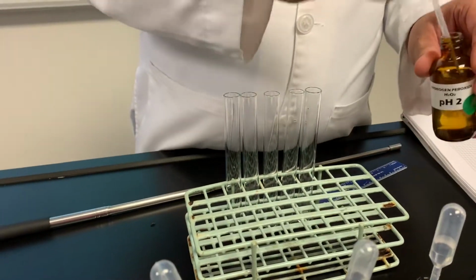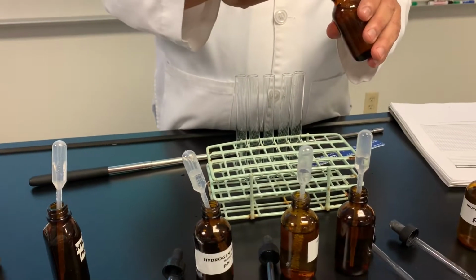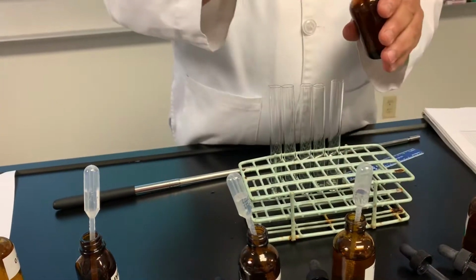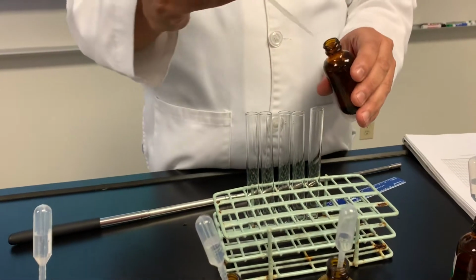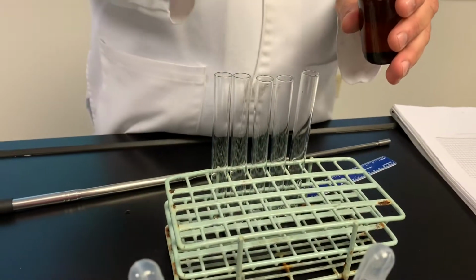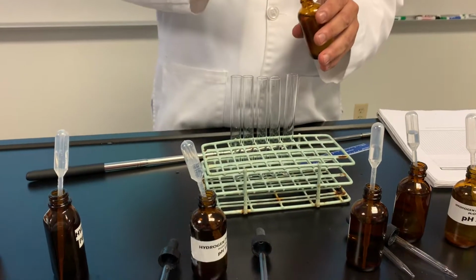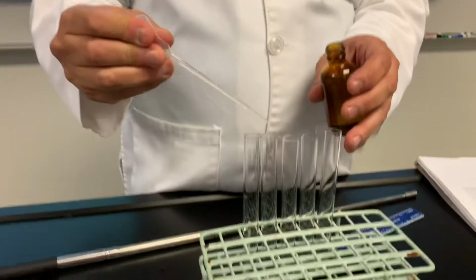Acid right there. Yeah, pH 2 would be acidic. So is pH 4. So if you touch it, would it run off your hand? Well, maybe. You're gonna feel the pain, and you're gonna run to the sink to wash it off, unless you have very strong willpower and watch your hand melt away. If you want to do that, don't do that, please.